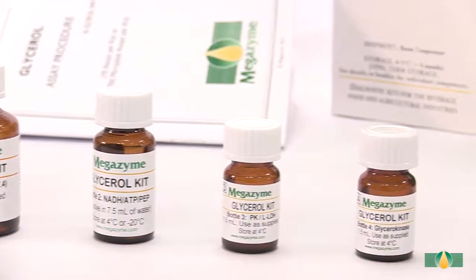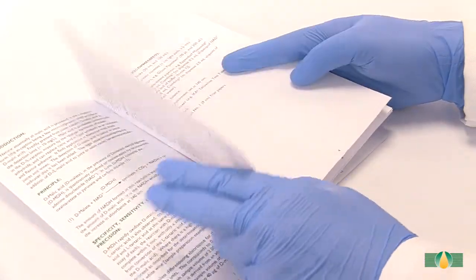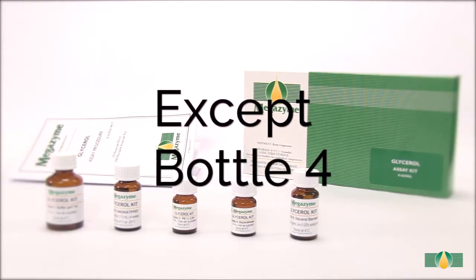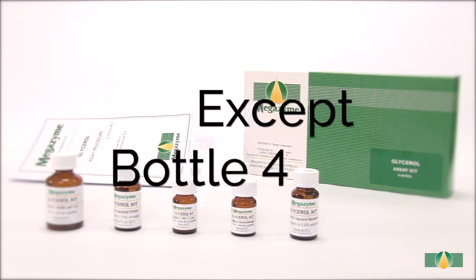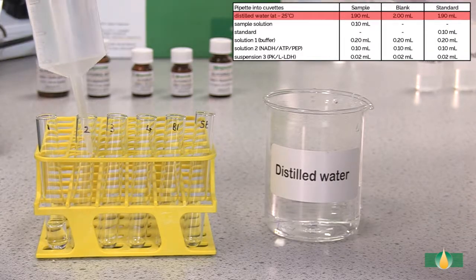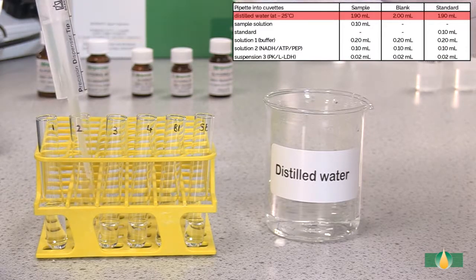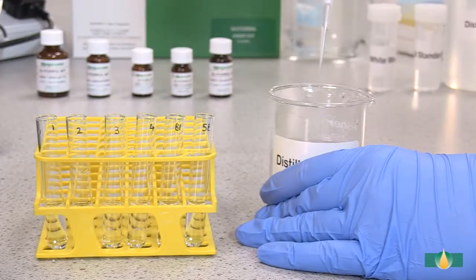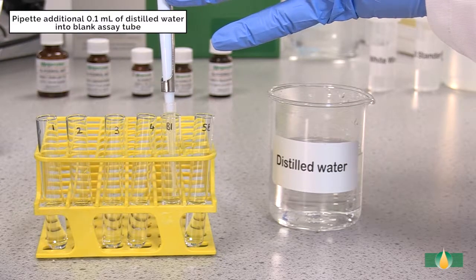Follow the manual assay procedure as described in the data booklet. Pipette all assay components except the final trigger enzyme in bottle 4 into each assay tube. A blank reaction and a standard reaction must be performed with each batch of samples. Pipette 1.9 millilitres of distilled water into all assay tubes. Add an additional 0.1 millilitres of distilled water into the blank assay tube.